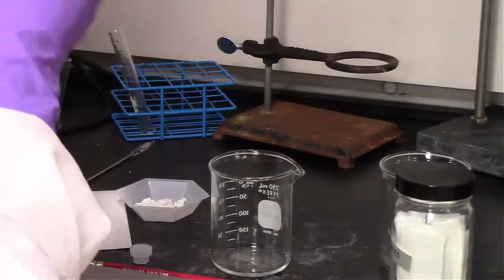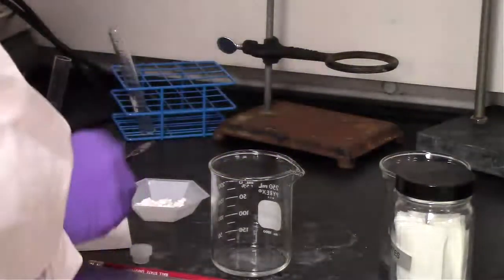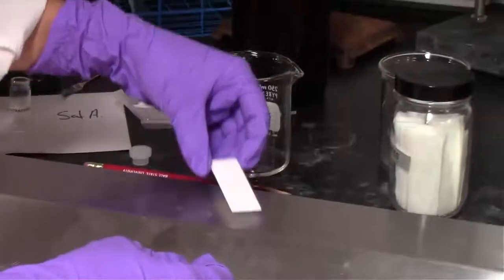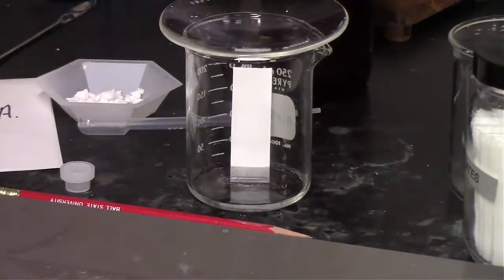And with that plate, it's always good to double check to make sure that your line where you've got your spotted compounds, or even more than that, even the bottom of the spot, when you look at that spot under UV light, you want to make sure that you do not submerge any of that spot in the liquid. So you can see there's definitely a space between the bottom of the 3 spots and where that original solvent line is at the bottom.